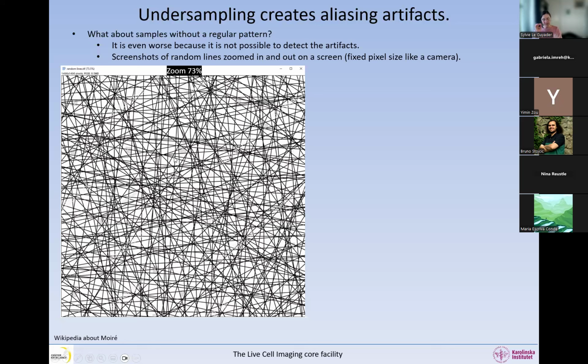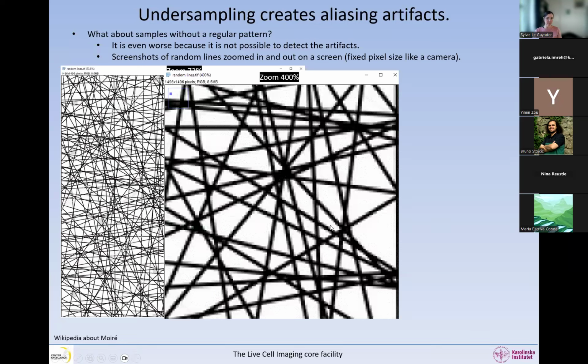And then I displayed this on my screen, and I took screenshots of it. So I have the pattern of the line, and then I have the pattern of the screen that overlay each other. And so if I zoom in, and I zoom out of this image, I see all the pixelation artifacts that are very clear on the lines. And you can see that they depend on the orientation. So this one has different artifacts. It has this strange thing here compared to that one. So it depends on the orientation of the lines. But we do not have any strange thing happening except for these that we do not resolve. So they all fuse together.